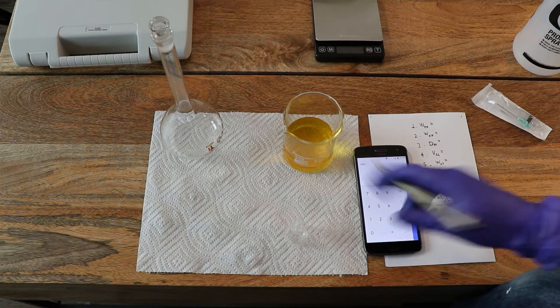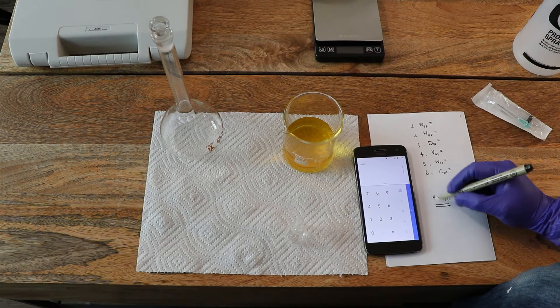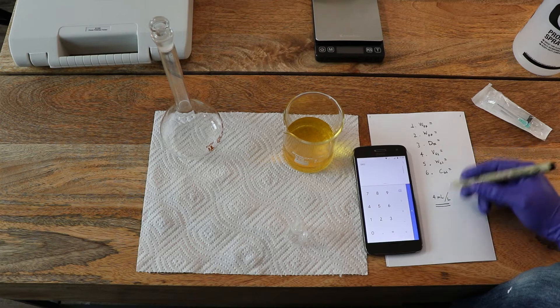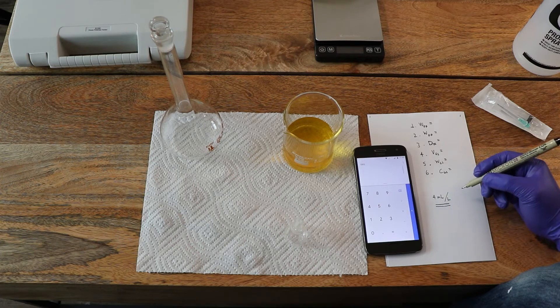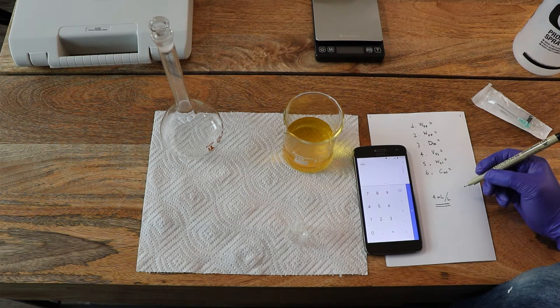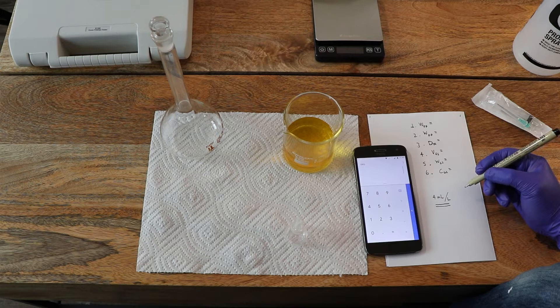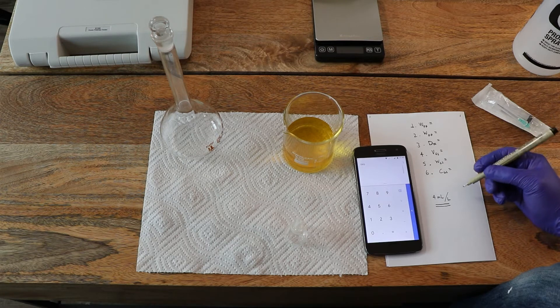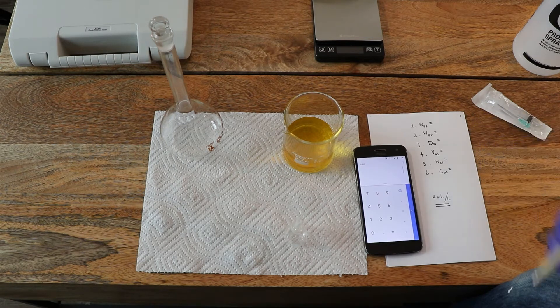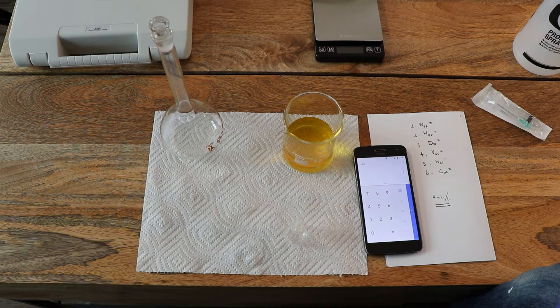This solution, if you remember, was meant to be diluted at four milliliters per liter of final solution, and we are going to be doing this by weight after we measure the density of it.